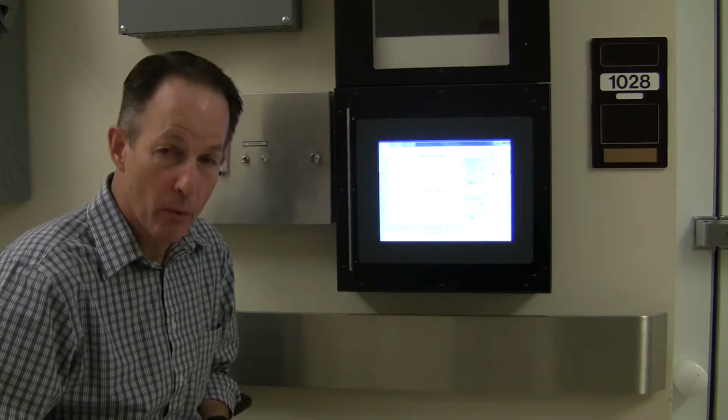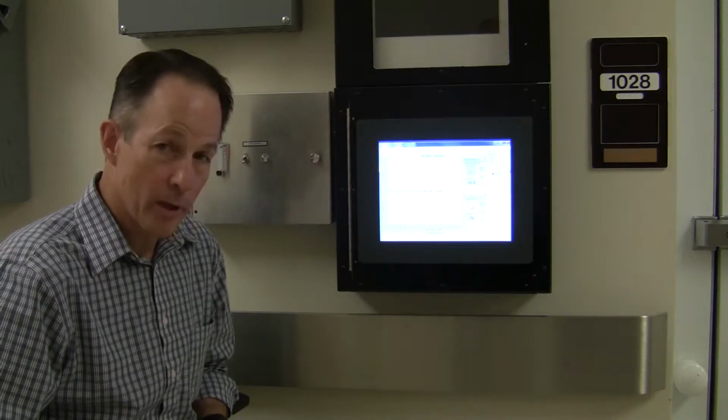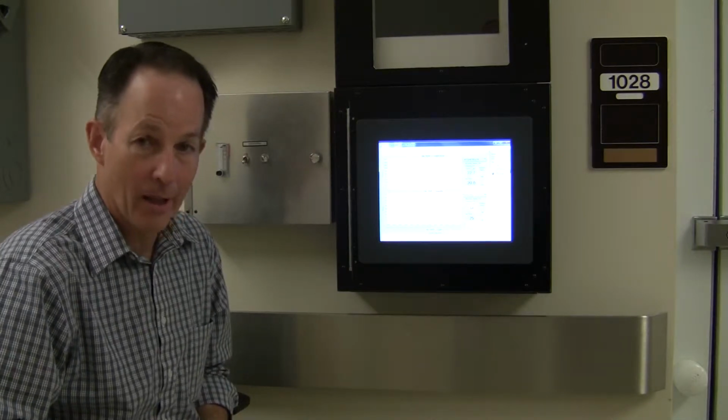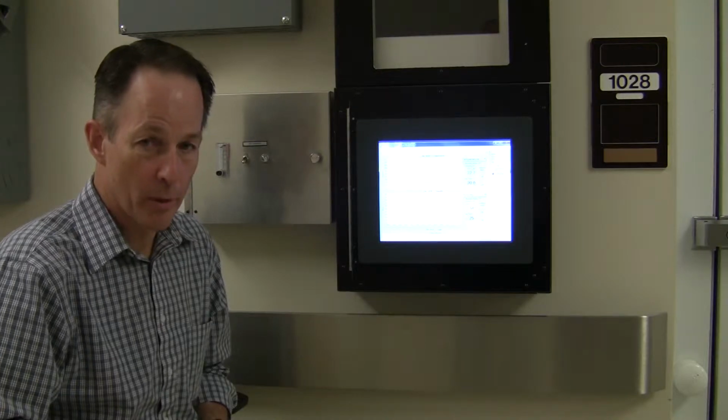Welcome to the review of the programming of the environmental growth chambers. We want to spend a little time on our interface here to show you how to program your temperature, your humidity, lighting, and CO2 control so that you can set up your experiment correctly.